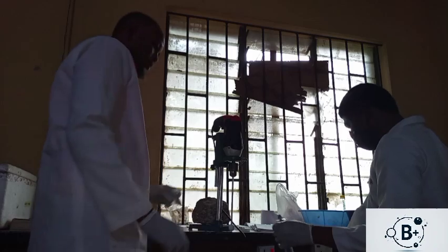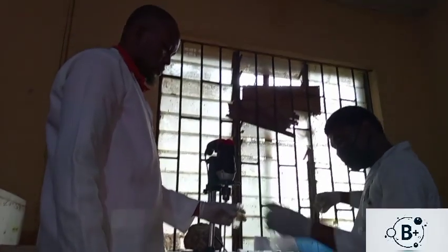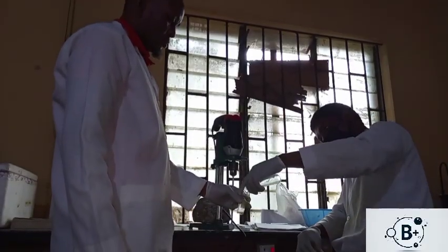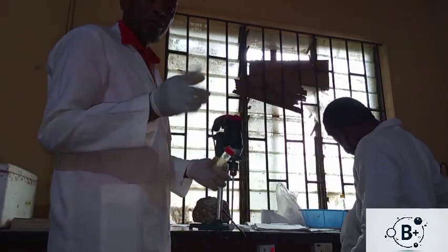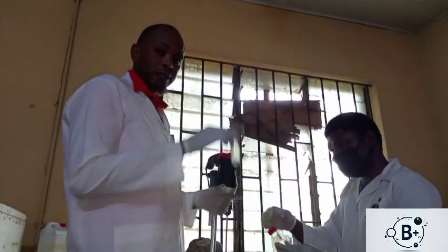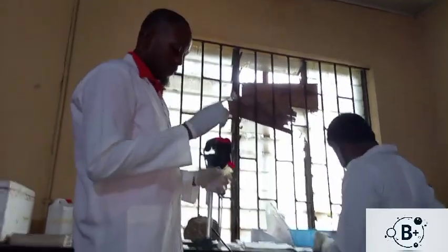We have a homogenized mixture, then flush with the remaining amount of homogenizing buffer. Then we cover this. Then we return it back to ice. Everything is done in ice condition. So this is taken from ice, then we replace it in the ice. Then we remove the metal from the ice also.